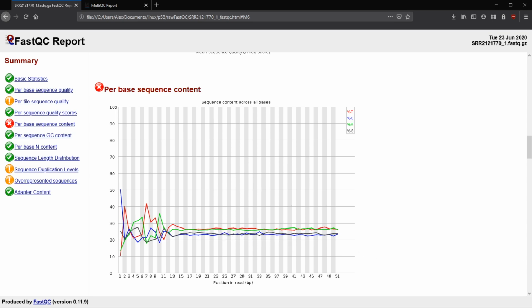So that could be from PCR or something like that if it's going to be an overrepresented sequence, and we'll get to some more of that below. And generally the beginning and sometimes the end are more poor quality, and they don't match up with the A and the T or the C and the G. Here, a warning happens if there is a difference between the A and the T or a C and the G greater than 10% at any position.